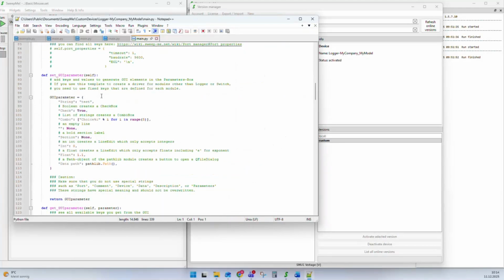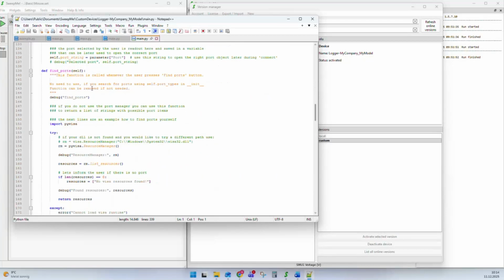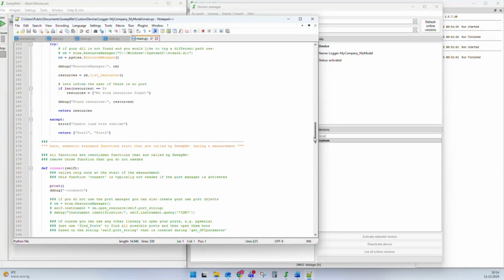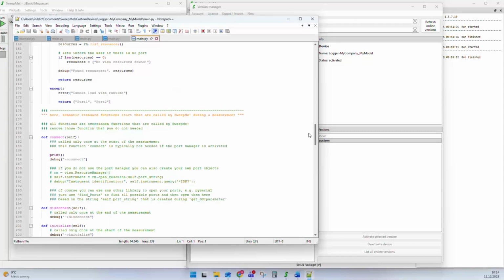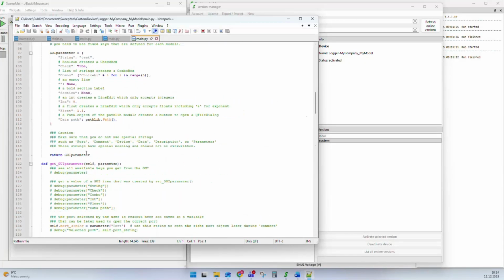coming from a template that has most features included that are typical for a driver. It comes with a couple of functions. I will go into the functions later on. But what you can see now is that we have here all the functions that you need, and now you can start filling them with the code for your instrument.